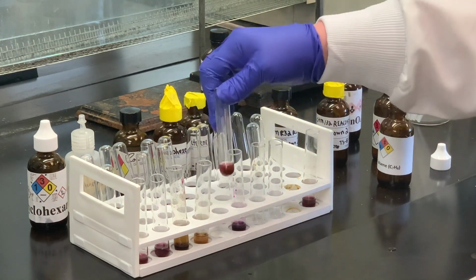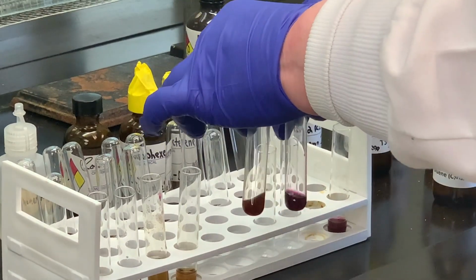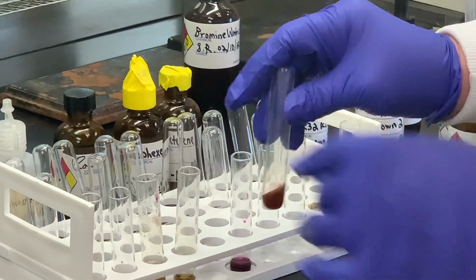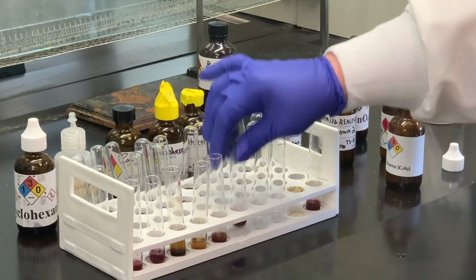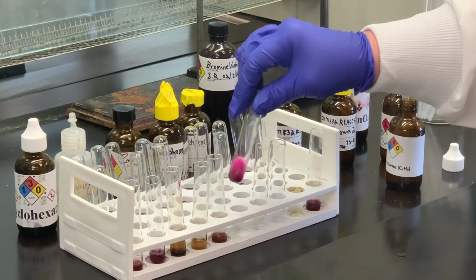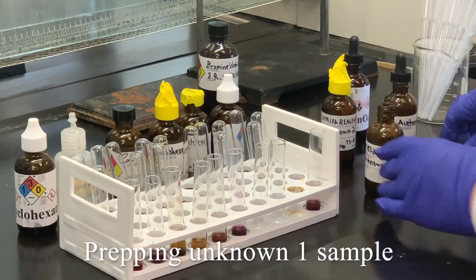I want to go back to the one before. You can certainly tell the difference between those two. So I would say that the 1-octene is certainly a positive test. Looks like the toluene is negative. I don't see any change at the moment taking place. And then we have our unknowns, so we'll take a look at those.